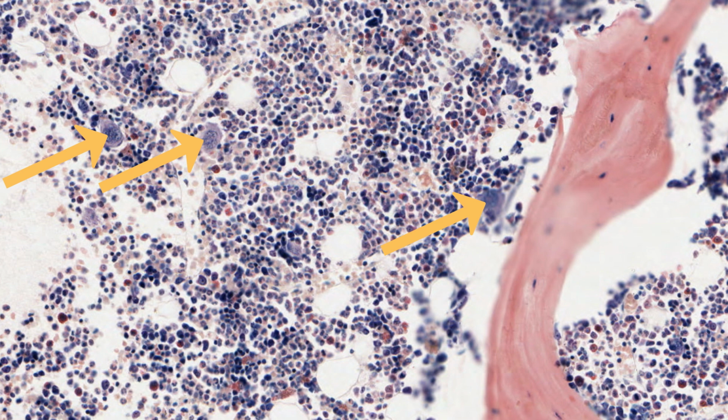Probably the main piece of information you learn from this section is that if you could carefully examine the section, the various developing cell types are scattered non-uniformly throughout the tissue. Cells of each lineage tend to aggregate together, which makes sense, since most juvenile cells are not very mobile.